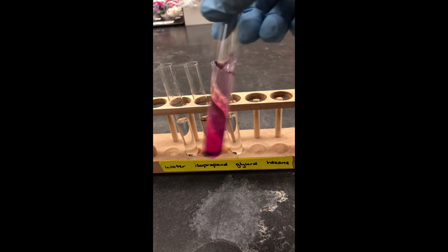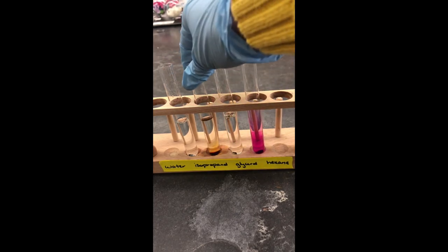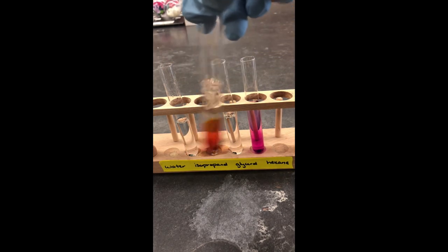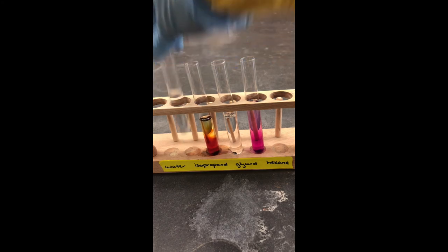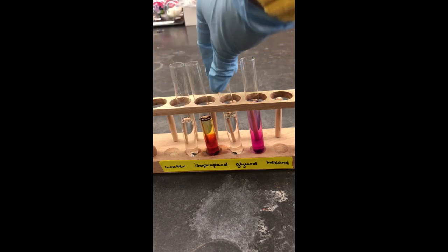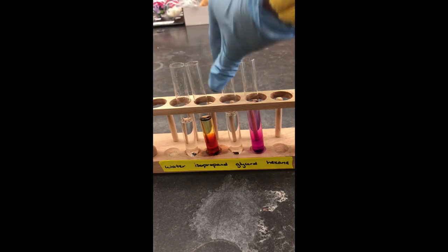And there it goes into the hexane. Into the isopropanol. Whereas in the water and the glycerol, it's not dissolving.